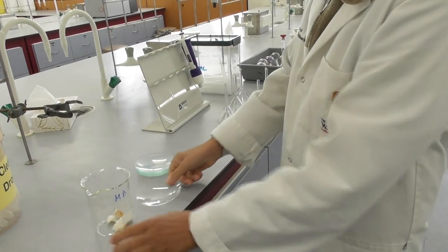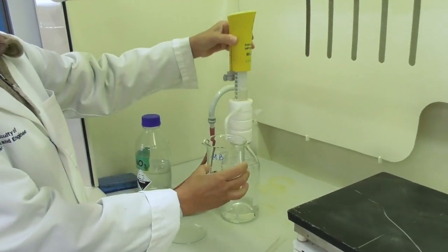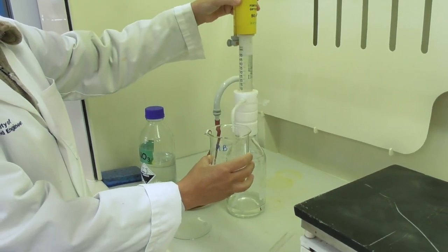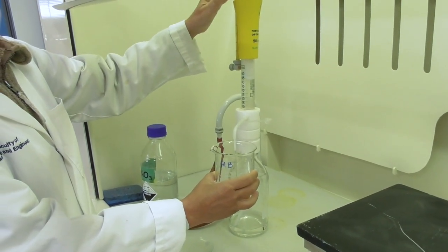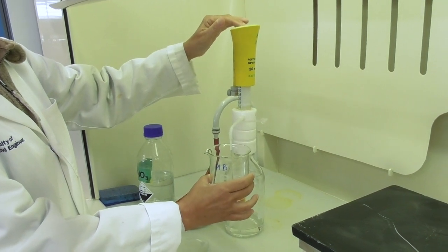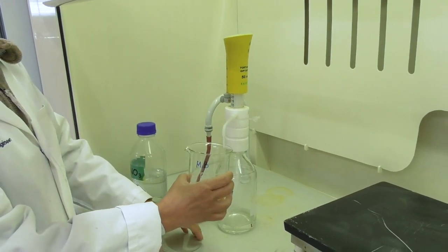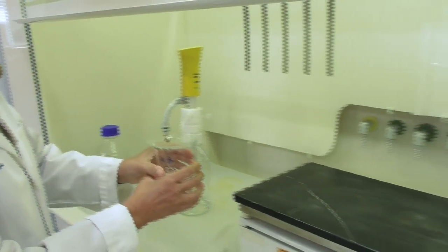I grab a watch glass and my beaker and head towards the fume hood where I add the nitric acid into my beaker. This is done with a dispenser which allows for contact free delivery of the acid into my beaker. This is needed to dissolve my bread in a process called digestion.